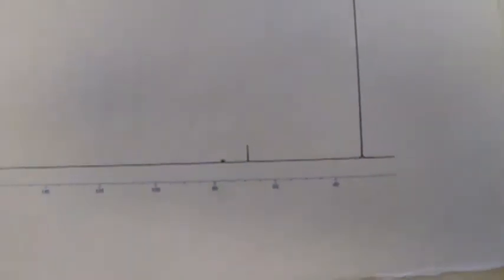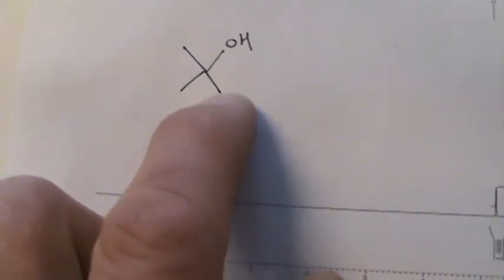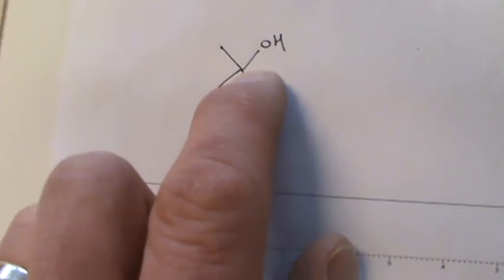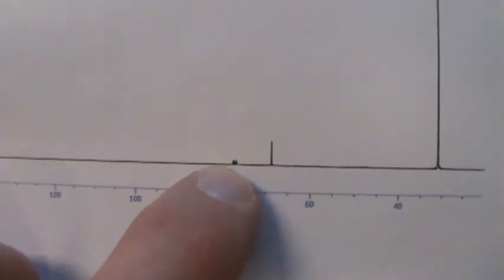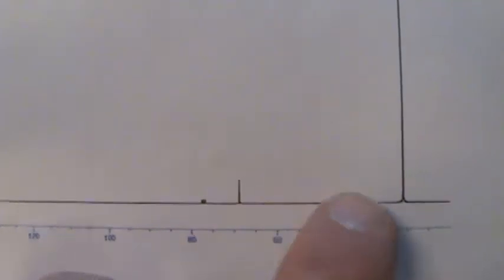This is the carbon 13, and yet again, carbon 13, how many types of carbon? There are 3 methyl groups that are the same, and you have a quaternary carbon, no hydrogen on it, therefore that's going to be Mr. Stubby, very small. So you look at this spectrum, that blip is at 77, that's chloroform-d. That is obviously that quaternary carbon of our compound, and then those are the methyl groups, the tall one.